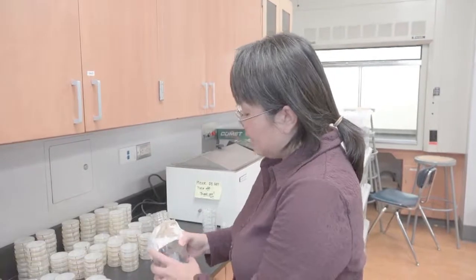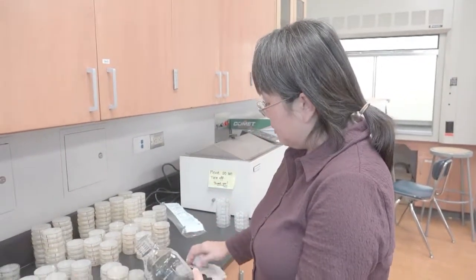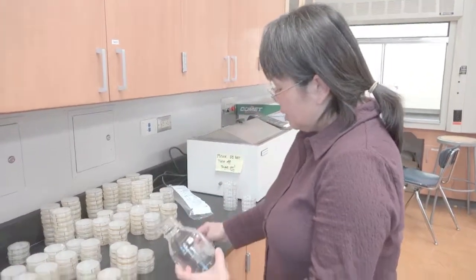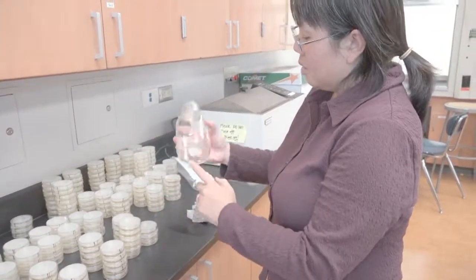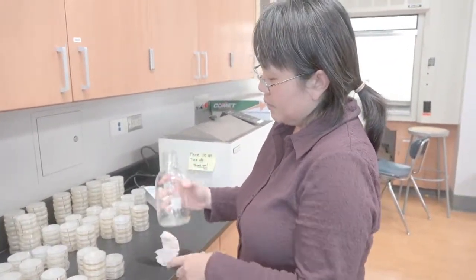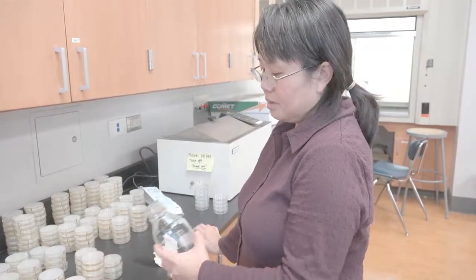In the meantime, this is an empty bottle. I want to rinse this as quick as possible so that none of the agar or any liquid that's left in there solidifies.